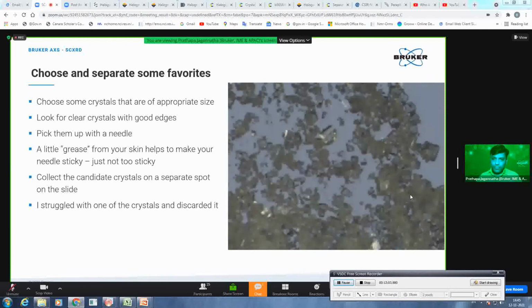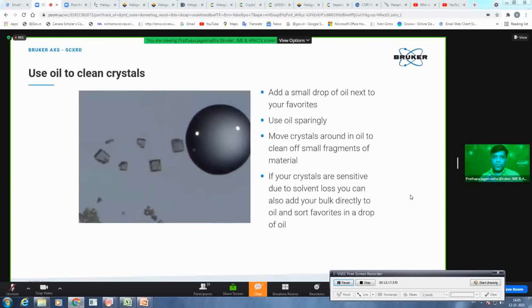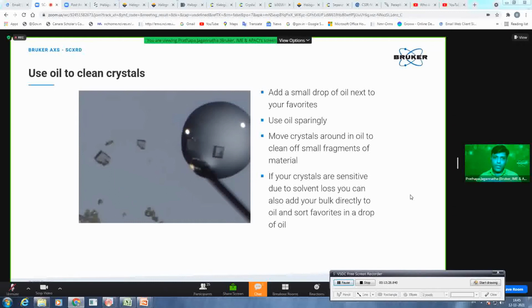Once he does this, in the second step he takes a drop of paratone oil with that same pin which he used to move the crystal, puts a drop of paratone oil on the side of the glass slide, and then takes those crystals which he selected into the oil. The purpose is that he wants to clean those crystals. If there is any secondary crystal or impurities or a precipitate sitting on that crystal, he wants to wash that off and take a pure single crystal.